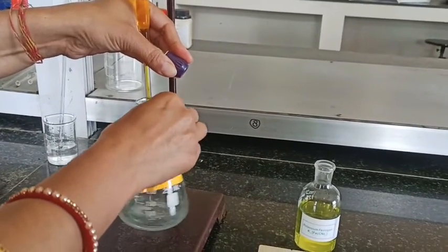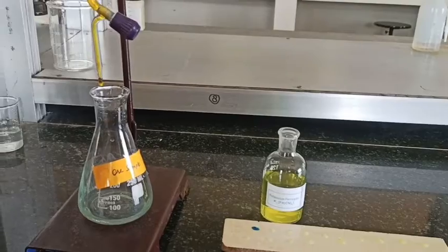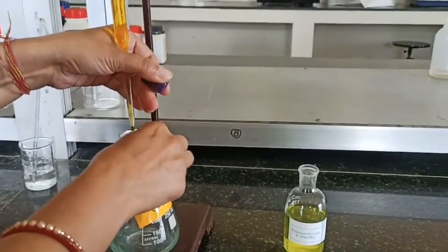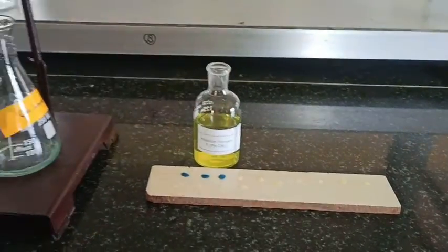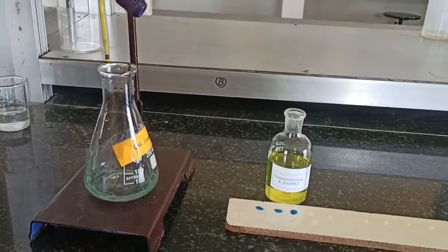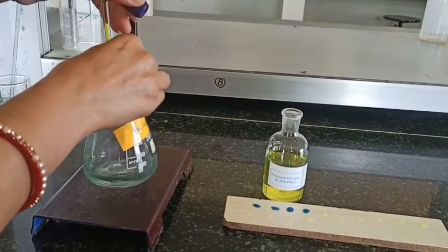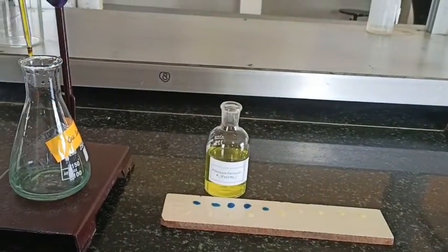So what I have done here is I started titrating the FAS, and now this glass rod which is dipped into the water, I wiped off and dipped into the solution, and it is mixed with the external indicator and it gives Prussian blue color. Now again I wiped off the rod, put it in the distilled water, and before using I always wipe it with tissue paper. Now I dip it in the solution, and this solution mixture is mixed with the external indicator and it gives Prussian blue color. So still we have this Prussian blue color. It suggests Fe2+ ions are present in the solution.